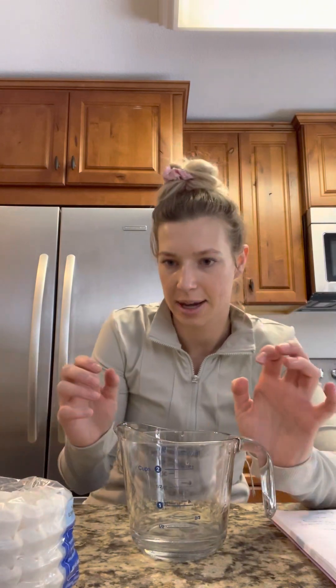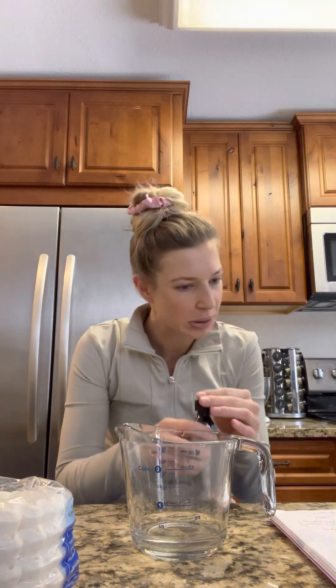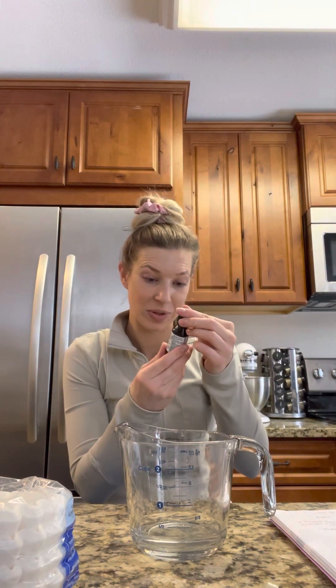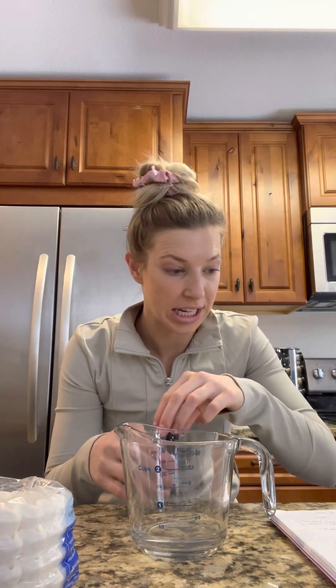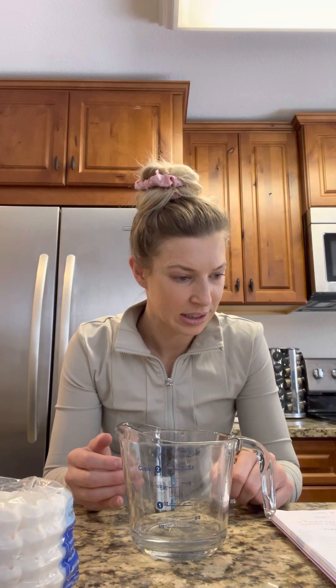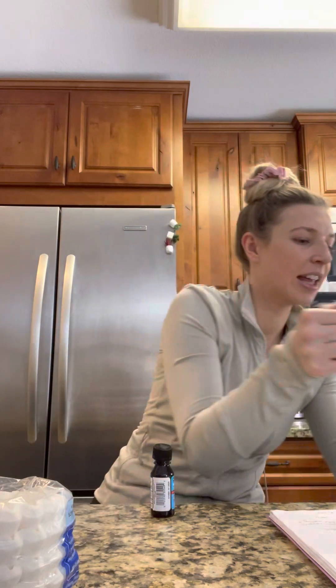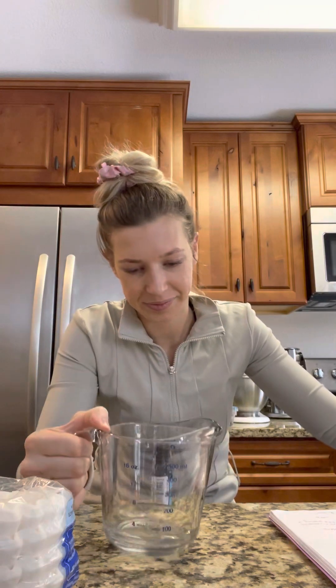It was actually Solution B that he heated up, so sorry about that. It looks like I have two percent iodine. I didn't — I should have got two of these; I only have one, so I'm wondering if I should split this in half. I'm going to pour a little out. I'm worried. I don't know if I'm doing great science right now.